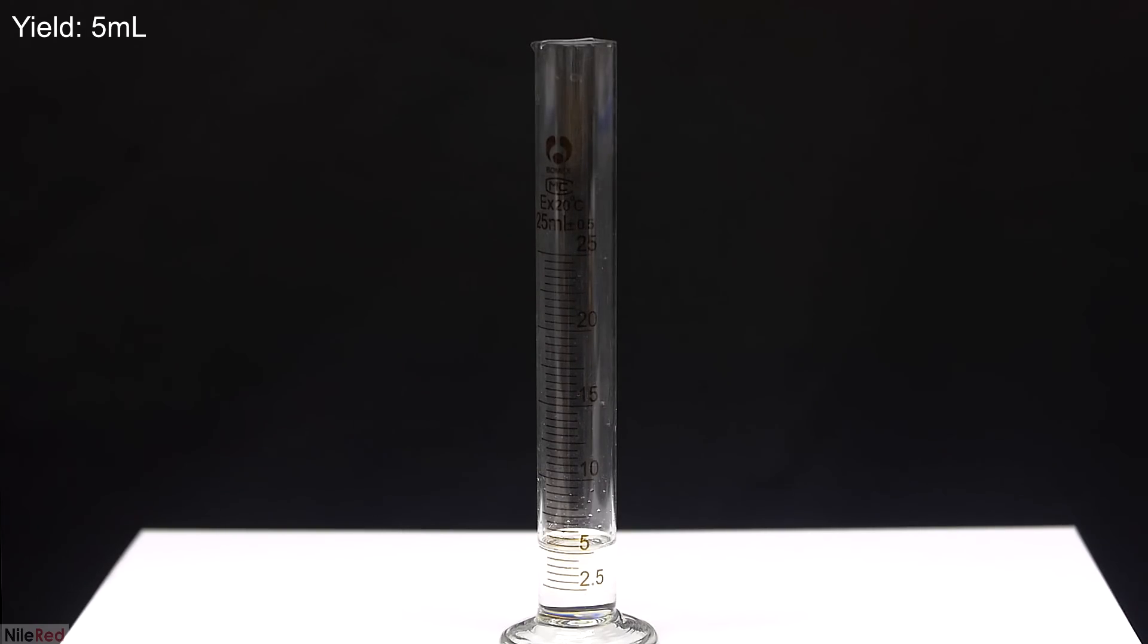In the end though, the point of this preparation wasn't really to get benzaldehyde and it was mostly to just explore the retroaldol reaction. Even if we find out that the yield was very good, this reaction takes a lot of work and it's not very efficient. In the future, I'm going to post two other videos on much better methods to get benzaldehyde.